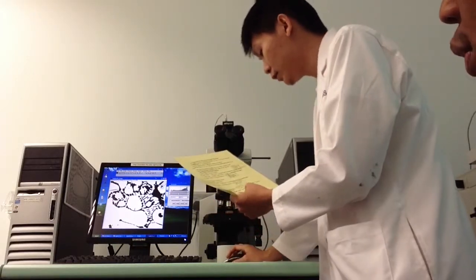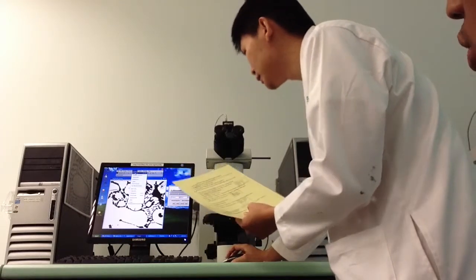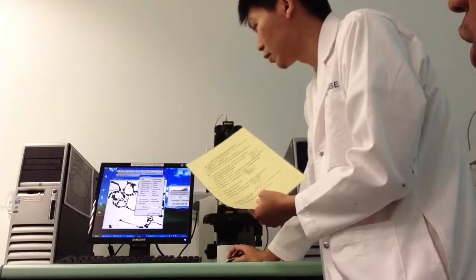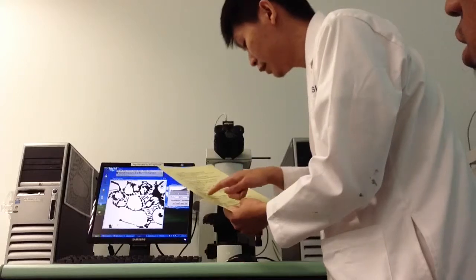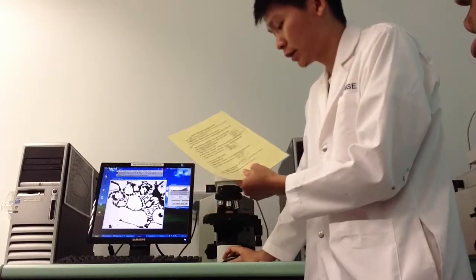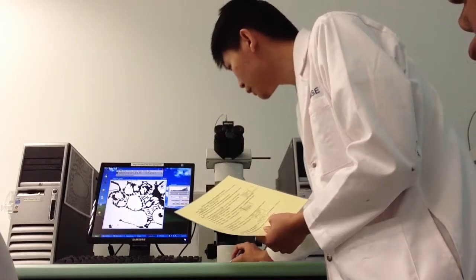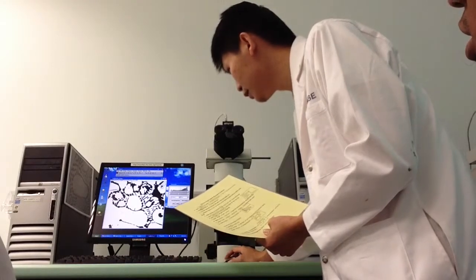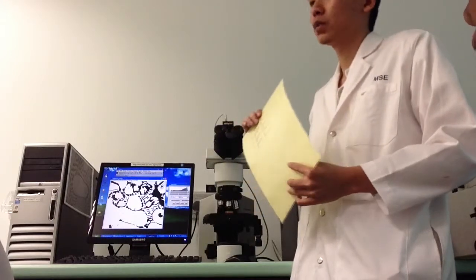Then step number 12 is select Analyze, Set Measurements. Ensure that the correct five things are selected. Then you have to do step number 13 again. Same, specify your selected area. Just select one hole without cutting into other detected phases.